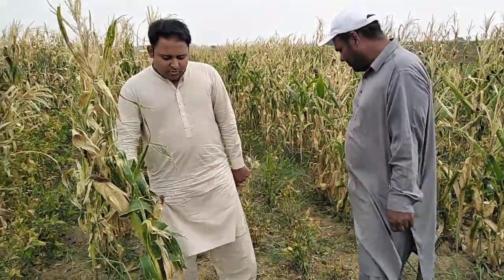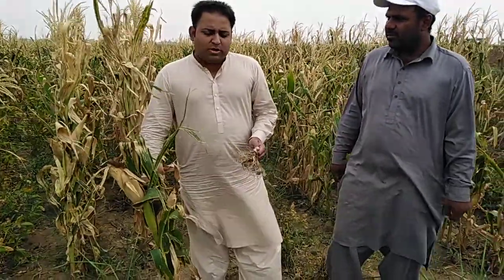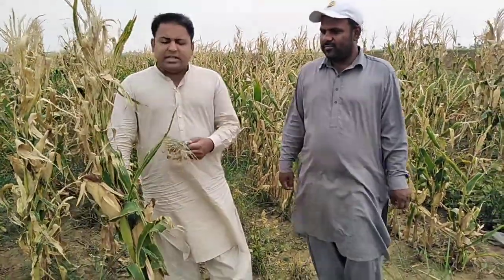Okay, my name is Dr. Muhammad Ali Reza. Today I am here at the request of Dr. Ghulam Abbas Shah to teach you how to measure the biomass distribution. First of all, you must know why we need to measure the biomass distribution. Biomass distribution is very important because this parameter will tell you how the plant is investing its dry matter in roots, in stems, in leaves, in its tassel and then in cob.